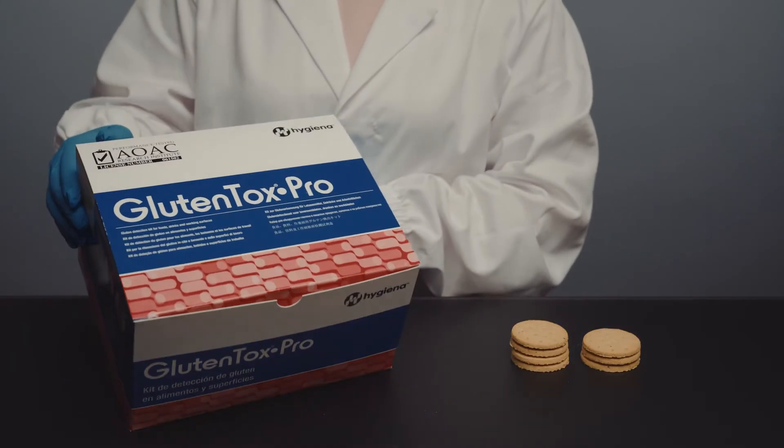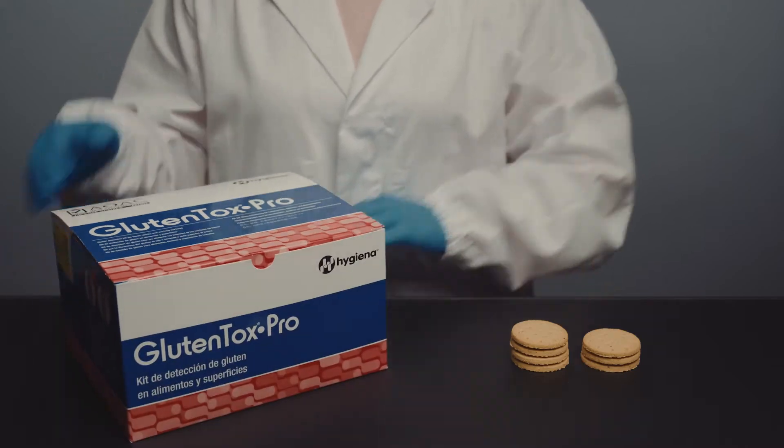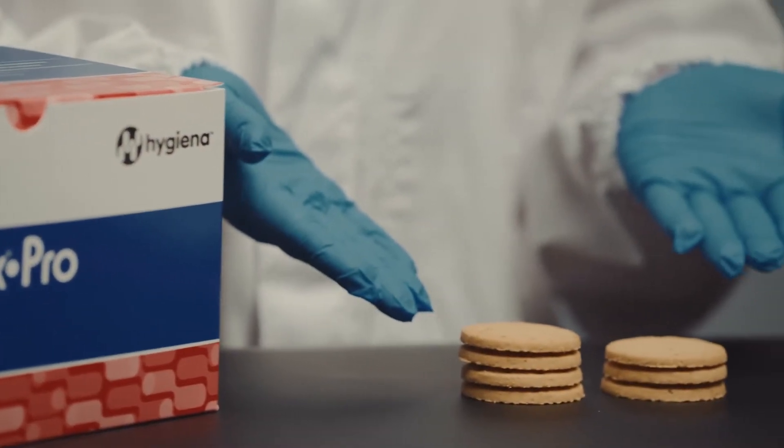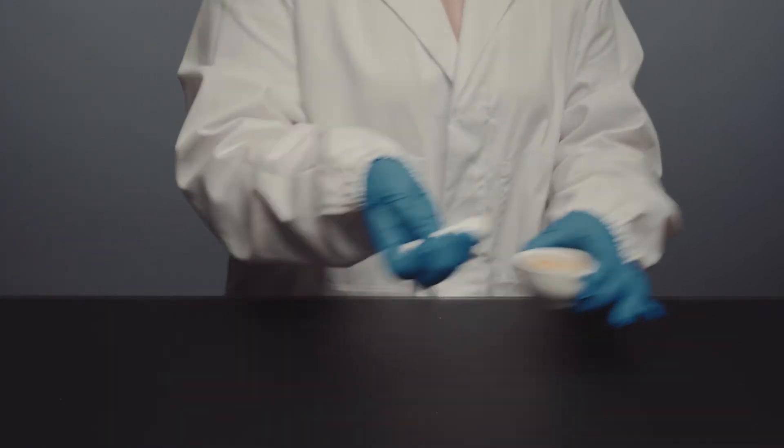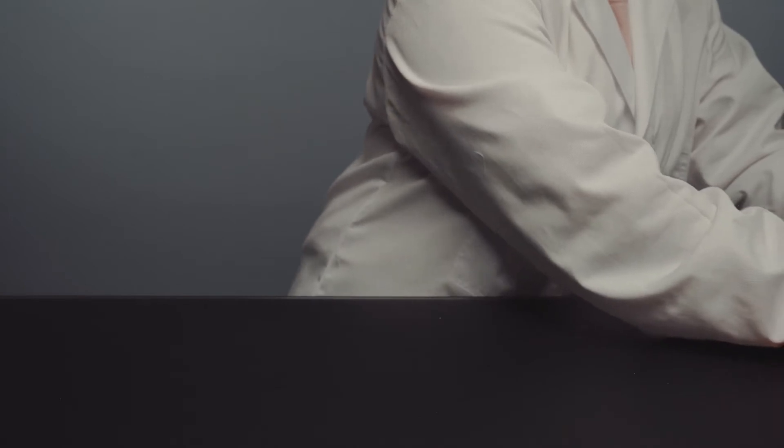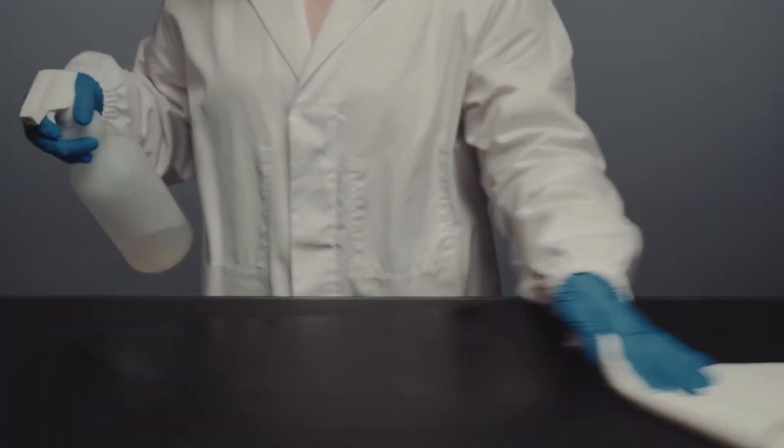In this video I would like to show you how easy it is to perform a Gluten ToxPro test. To do this I'm going to test some gluten-free cookies. Step one, using a pestle and mortar break down the cookies into a fine crumb. Put the sample aside and clean the bench with ethanol.